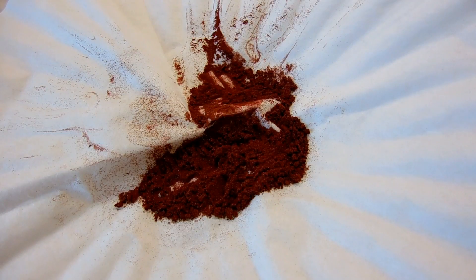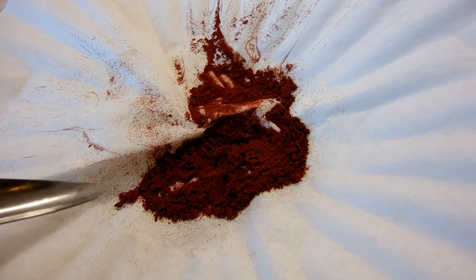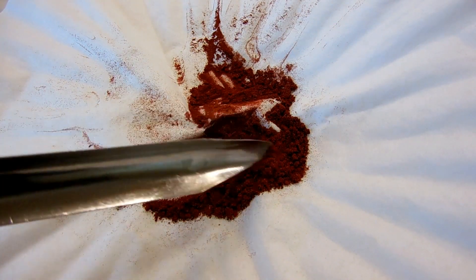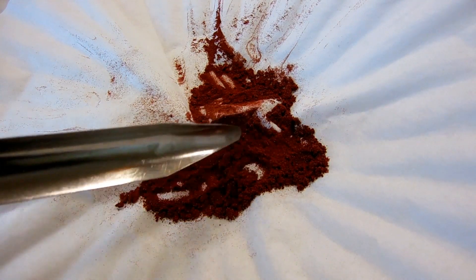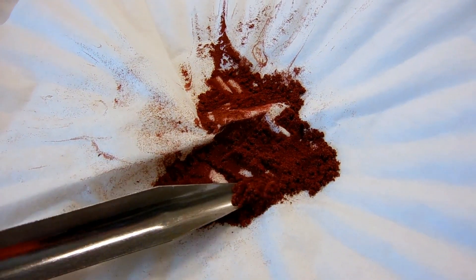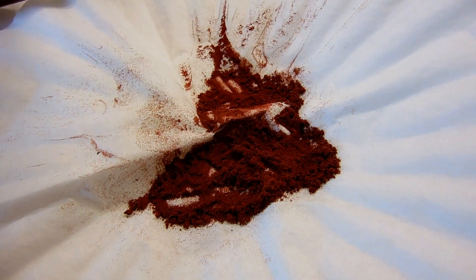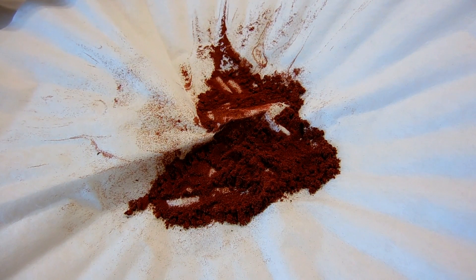Now here's my final filtered and dried precipitate of Chevreul's salt. Now you can see it's a really gorgeous brick red color and it's a really nice crystalline precipitate too. So it filtered very easily. Now the interesting thing about Chevreul's salt is first of all it's red which is very rare for copper compounds. I mean just about all copper stuff is blue or green in color. But this is red.